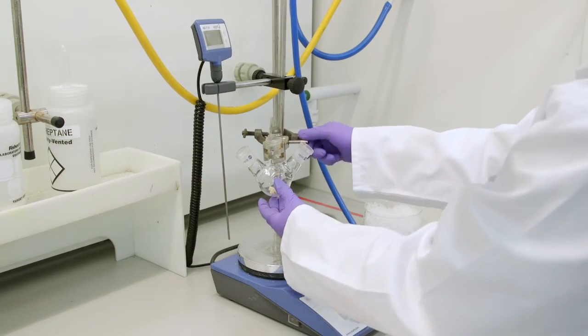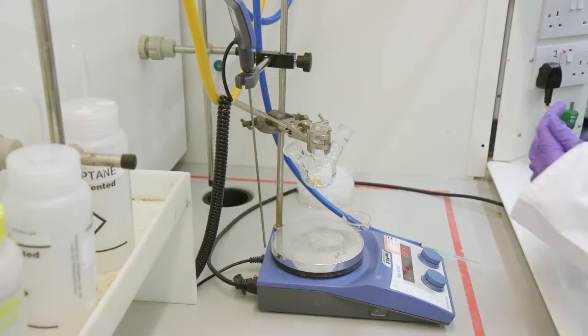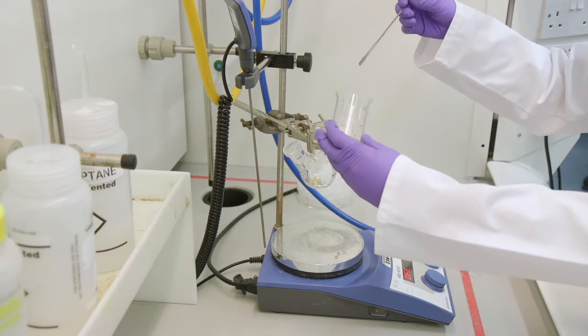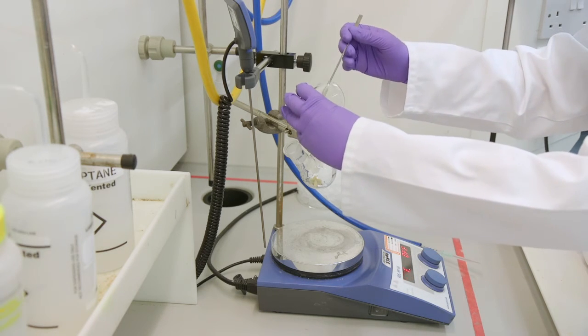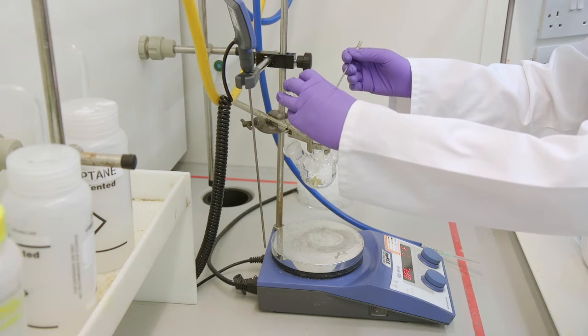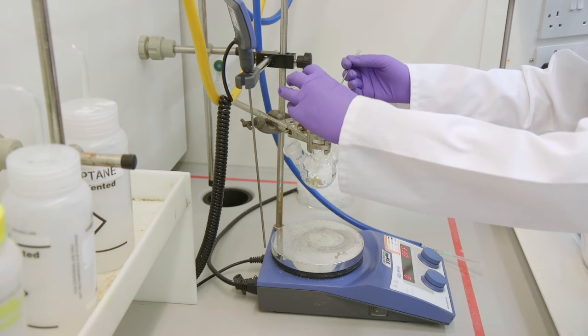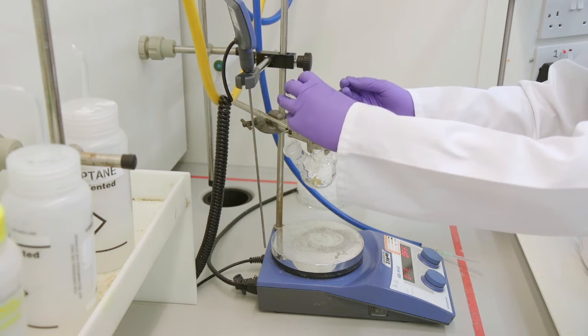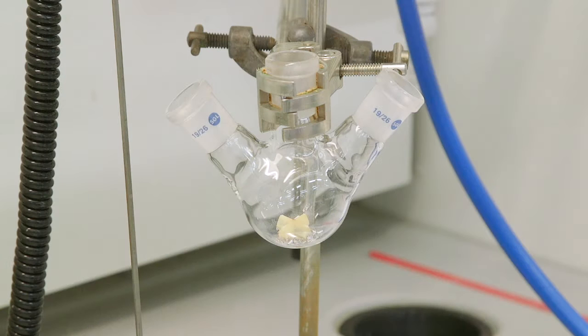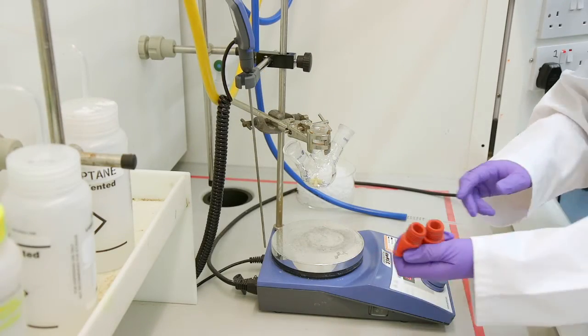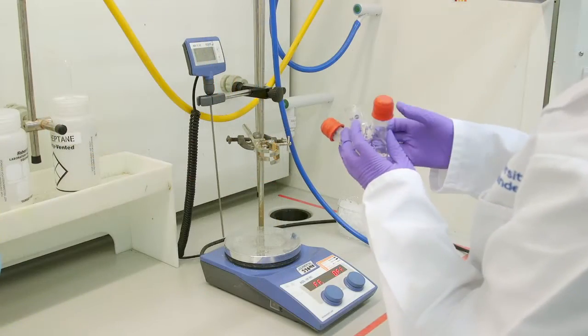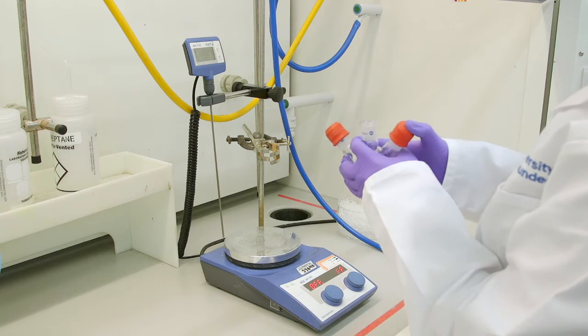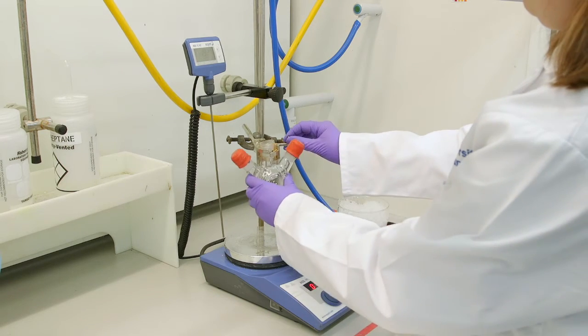It is possible to do these reactions in a single neck flask but it is better to do them in a multi-neck flask. This way you can keep your condenser attached whilst adding in your reagents. Next we are going to attach our condenser to the top of our multi-neck flask.